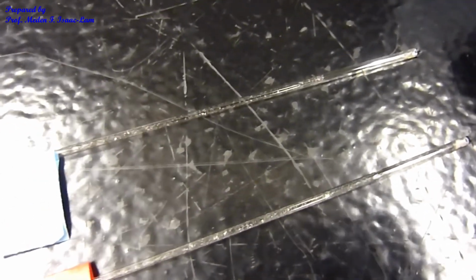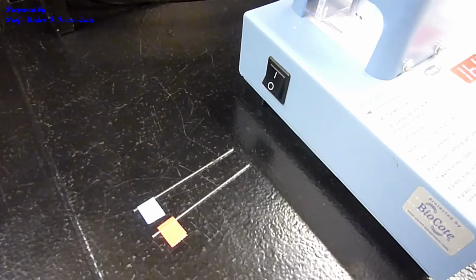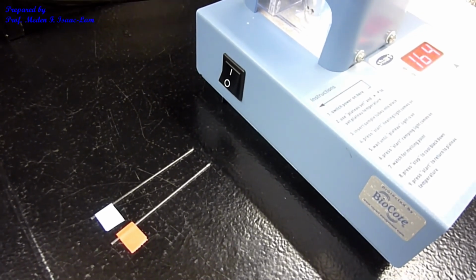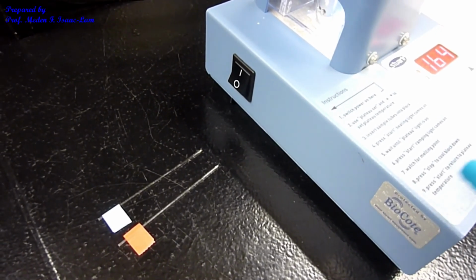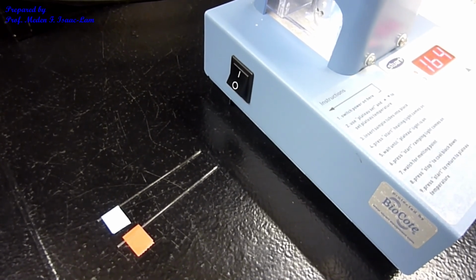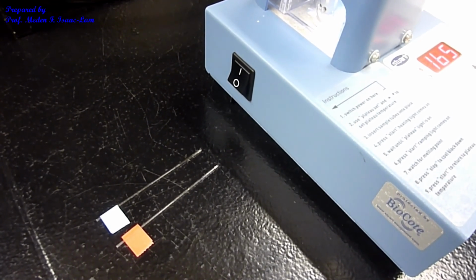If it did not melt, you are going to ramp it to the next melting point temperature, which is 173. If it does not melt, you will set the plateau to the highest temperature for the sample, which is going to be 182 for the carboxylic acid. But for this particular unknown, we are done. And now we have the data to determine what unknowns we have in the 3-component mixture.